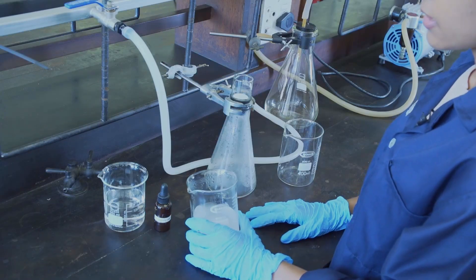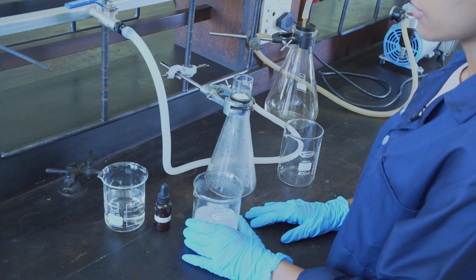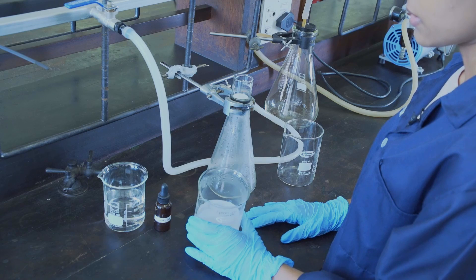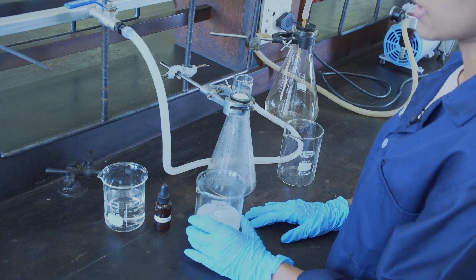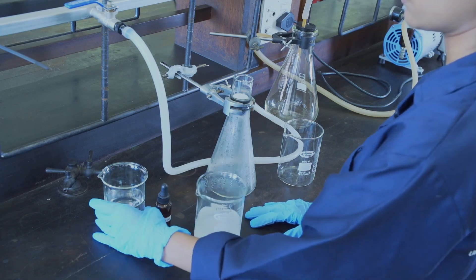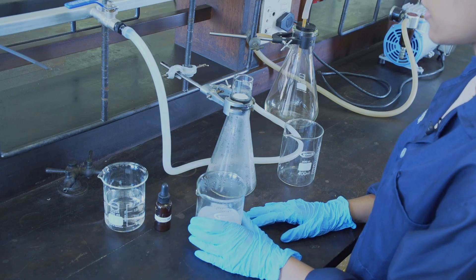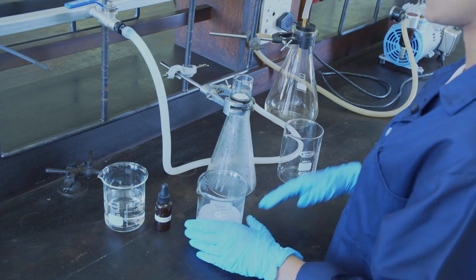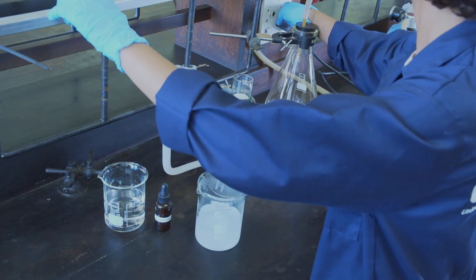We are now going to filter our precipitate and we are going to do that by decanting out the liquid. Once we have the solid, we are going to rinse out the beaker with hot water. We are going to filter by connecting it to a pump, and that is what I am going to switch on now.